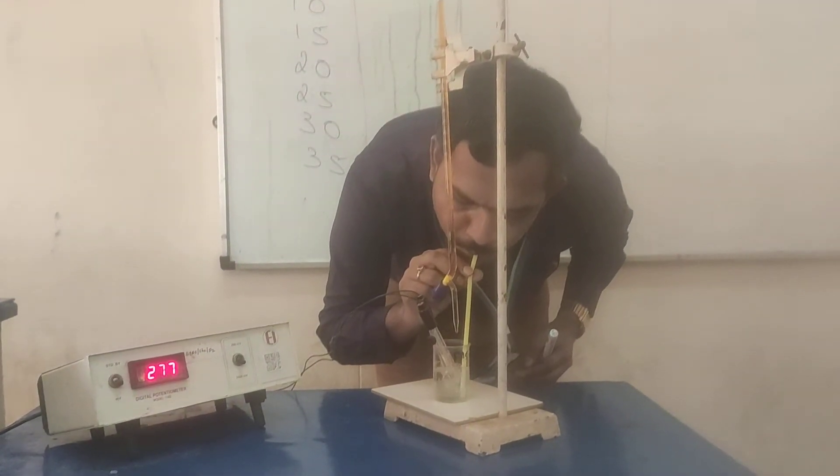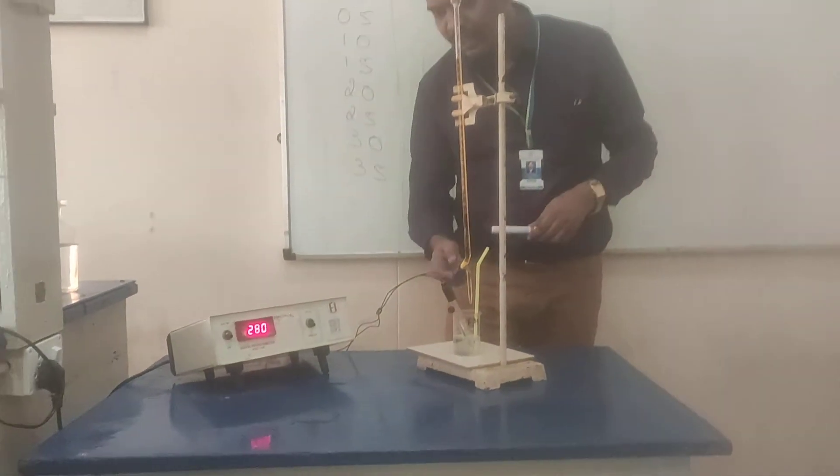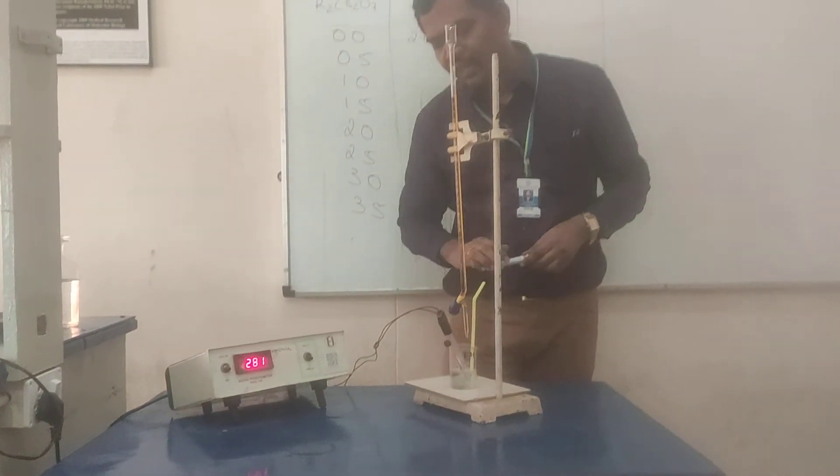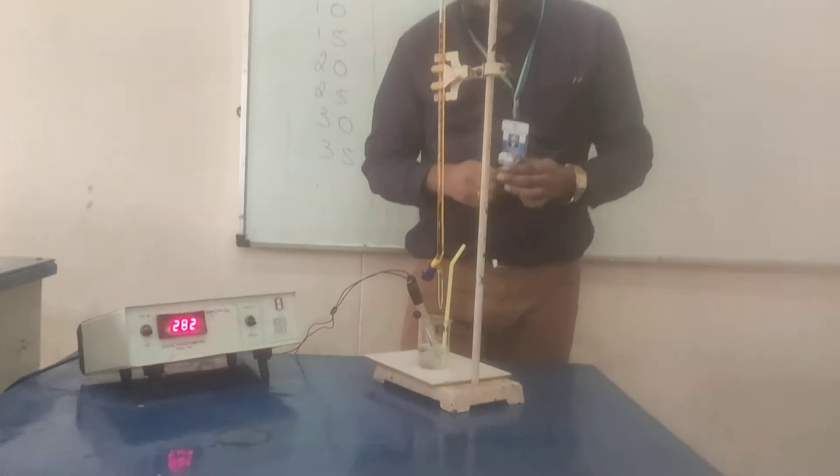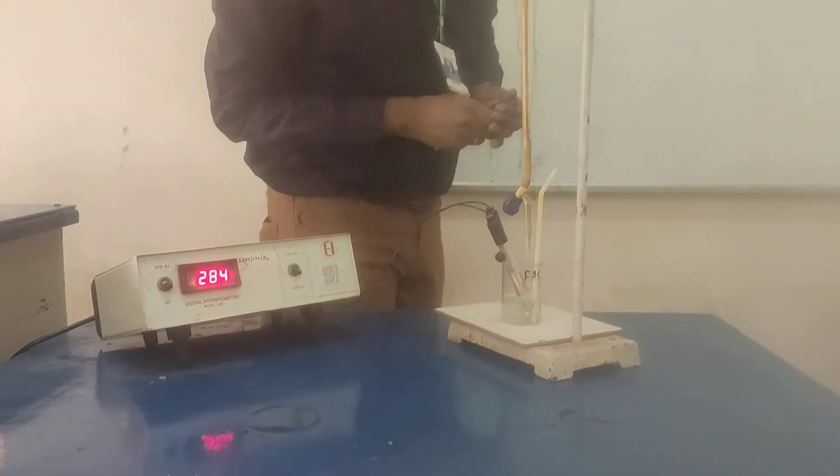What happens? Fe²⁺ will get oxidized to Fe³⁺. You can see it is changing color. You will get light blue color. So, the EMF also increases. It is around 284.